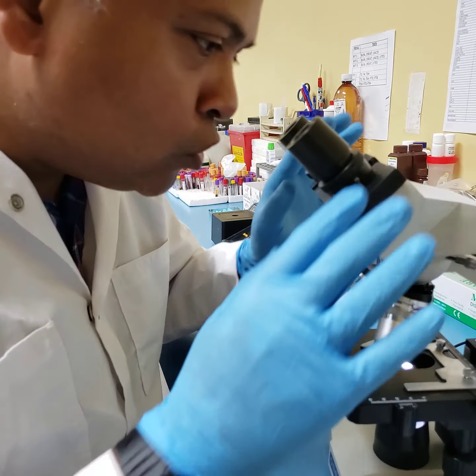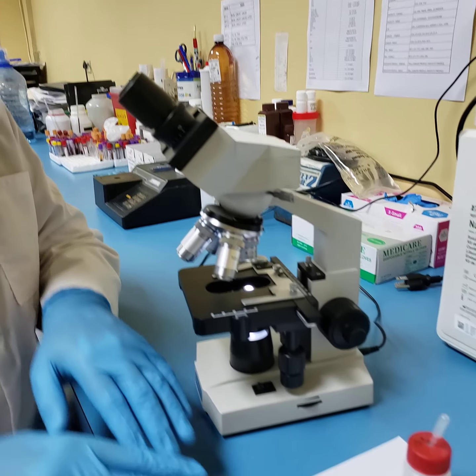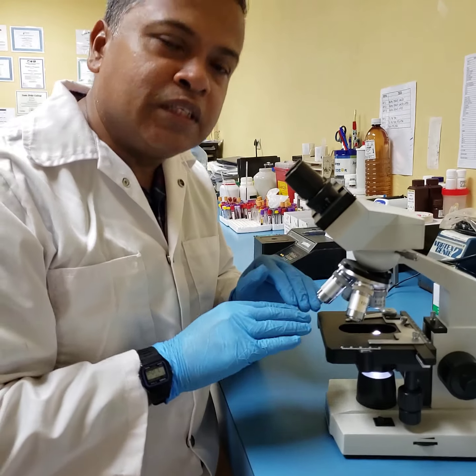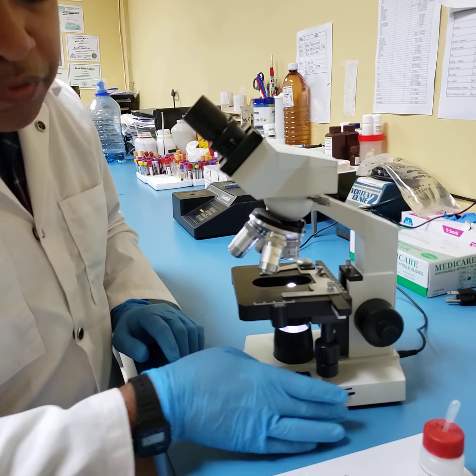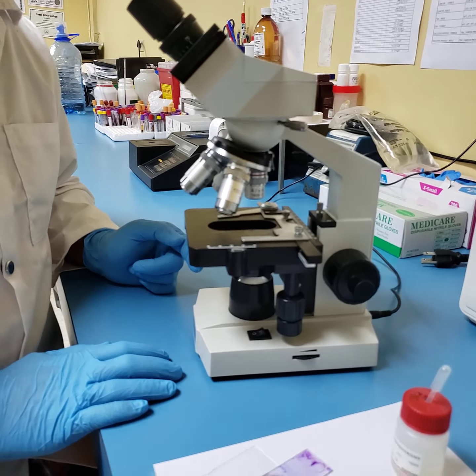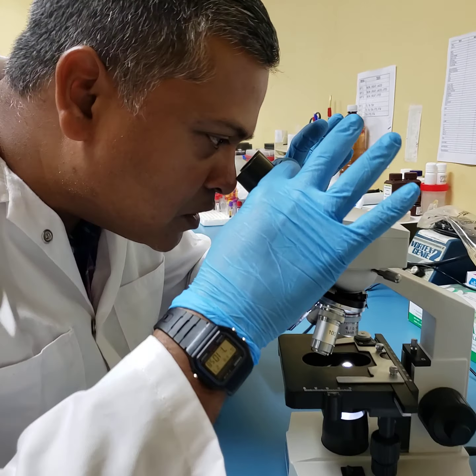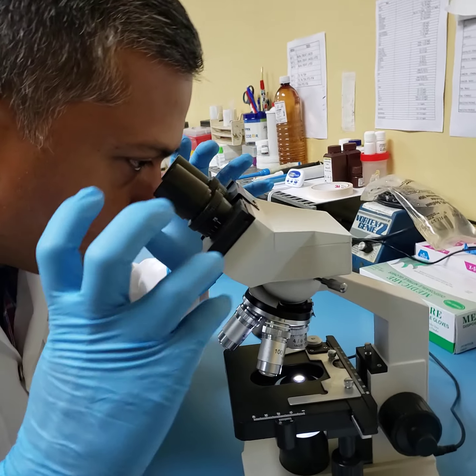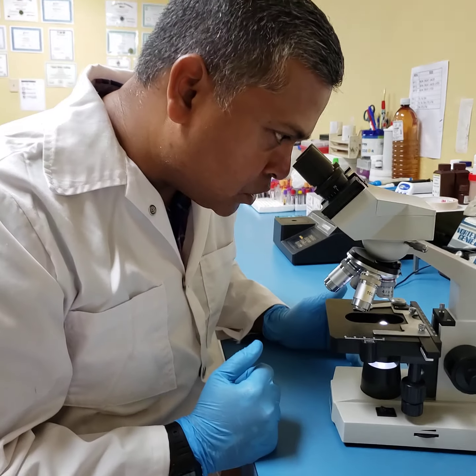Very important. Once you have located one zone of illumination, you notice no slide or no image has been placed on this stage as yet. That is step number two. Step number one, just to recap, you power on your microscope. Step number two, you adjust your eyepieces so that you see one zone of illumination using both eyes. I have just accomplished that.